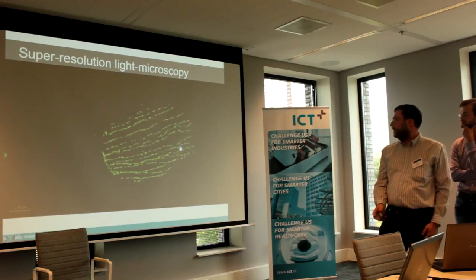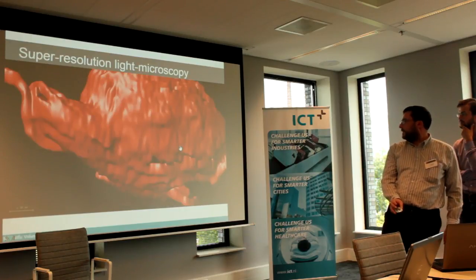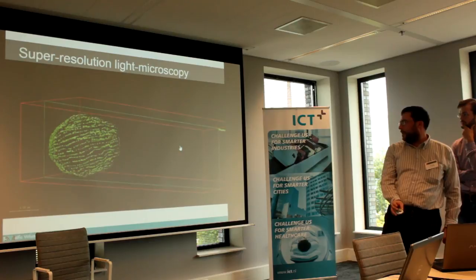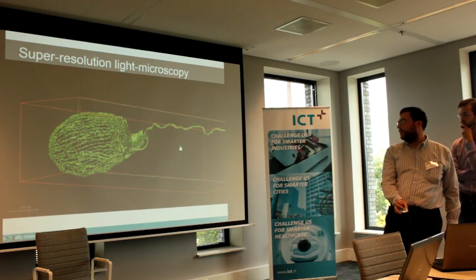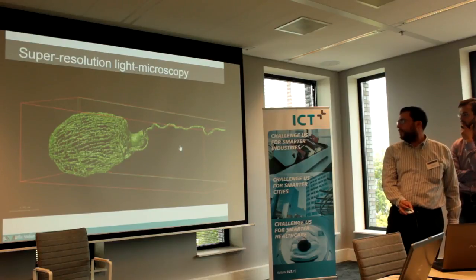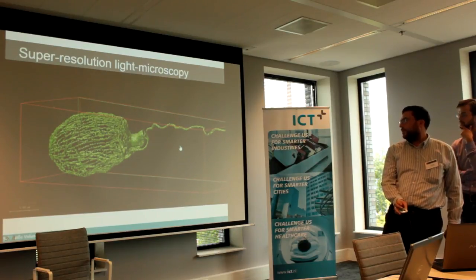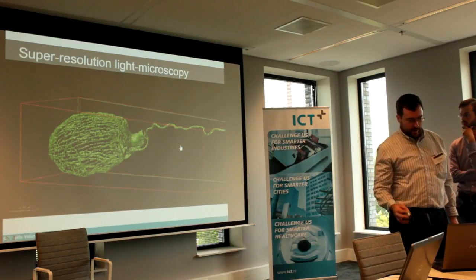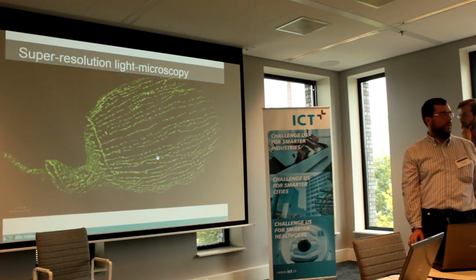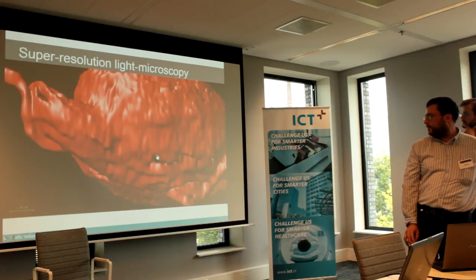This is an example of an image, or actually a movie. What you are seeing is a dinoflagellate, a kind of algae cell, and then you see the microtubules visualized. You see in the red channel the traditional confocal microscopy technique, and in the green channel the equivalent image acquired with a super resolution technique. And this is surface rendering, so in the super resolution technique you can see more details. This kind of animated movie is an example of what you can make with the software in terms of visualizing some results.